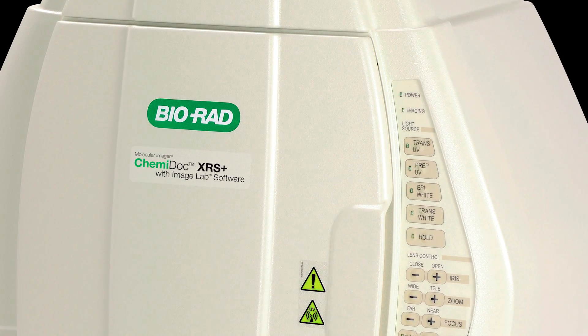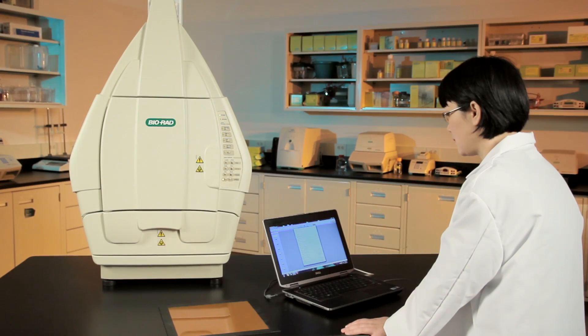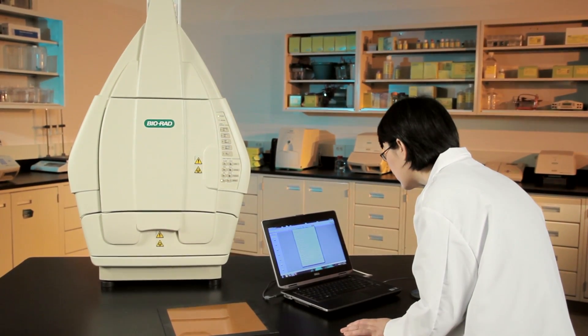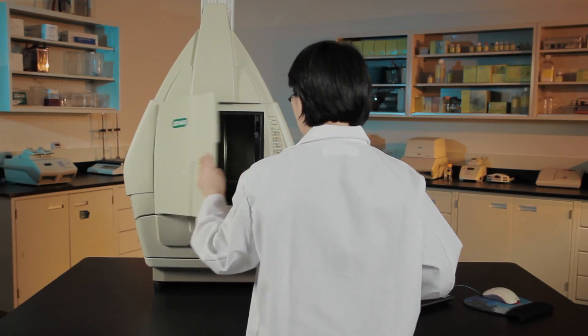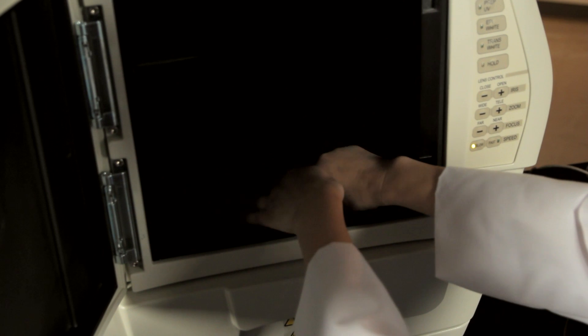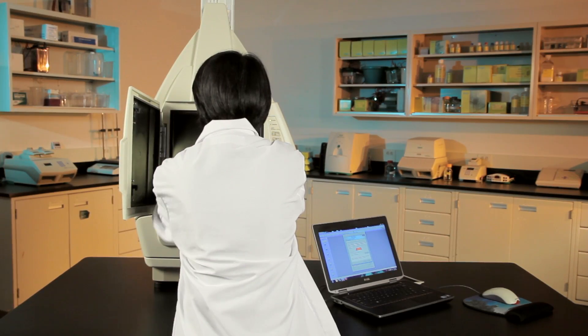Take a look at your camera if you are unsure of which Bio-Rad imager you have. We will first perform the flat field calibration required to correct for non-uniformity of the light source, which is critical for accurate stain-free total protein normalization. This step requires the use of a fluorescence reference plate. If you do not have this plate, you can contact Bio-Rad technical support to arrange for the reference plate to be sent to you on loan for conducting this calibration step.